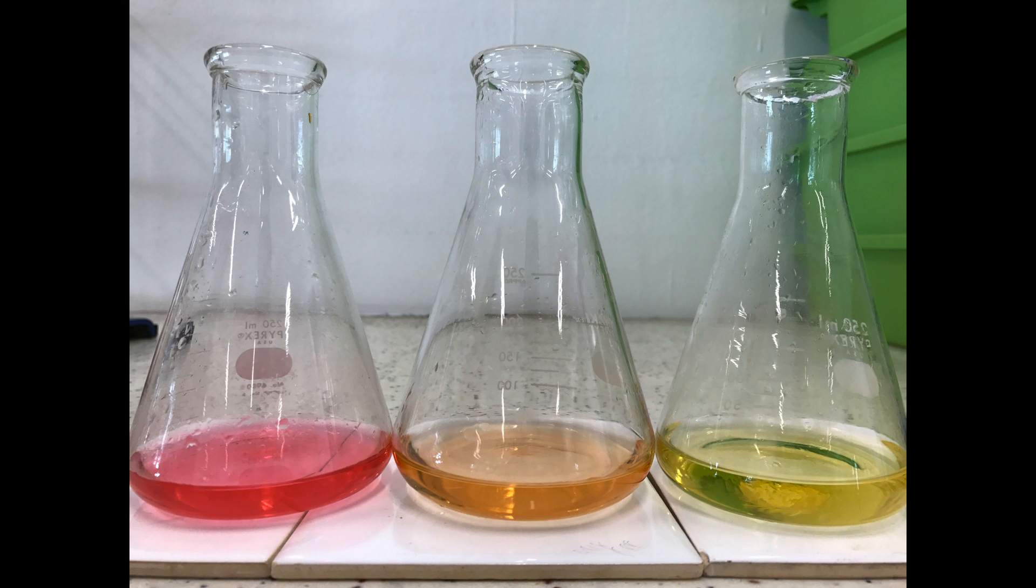Careful dropwise addition near the end point is very important to obtain the orange colour. If you have exceeded the end point, you will get a yellow colour, and therefore the titration results will not be valid.